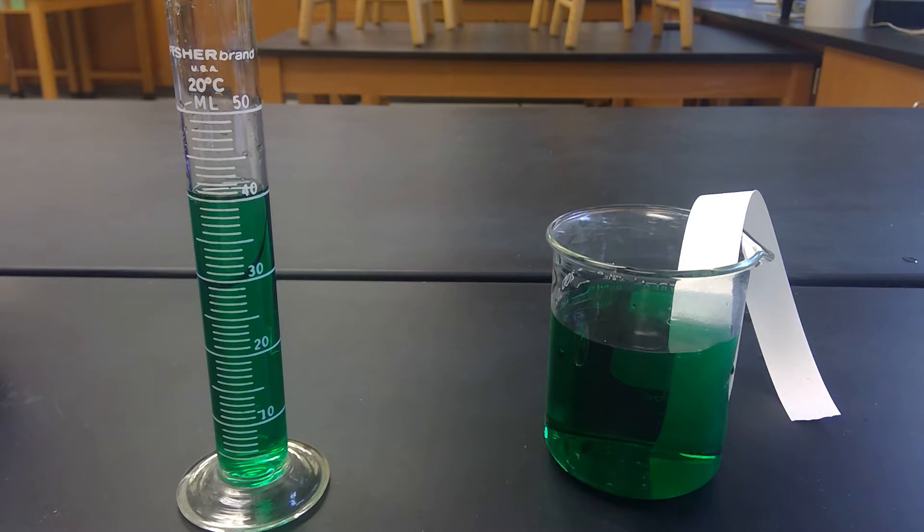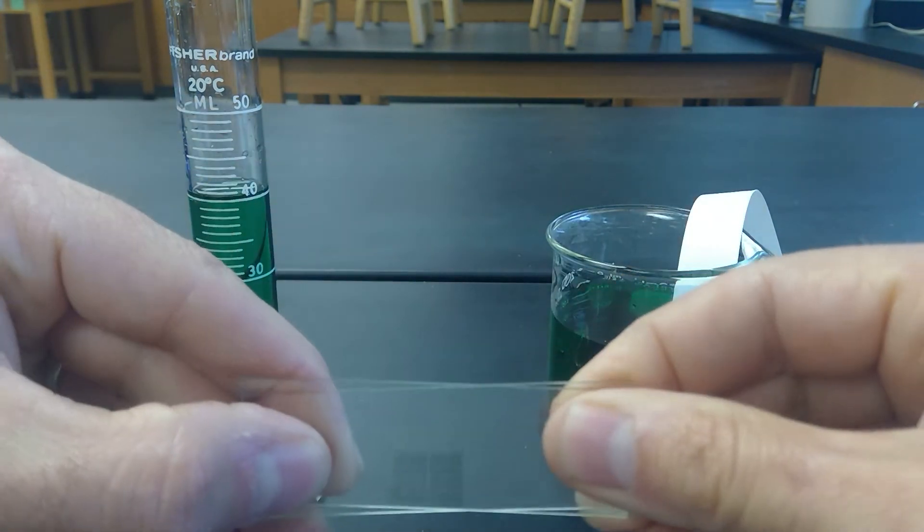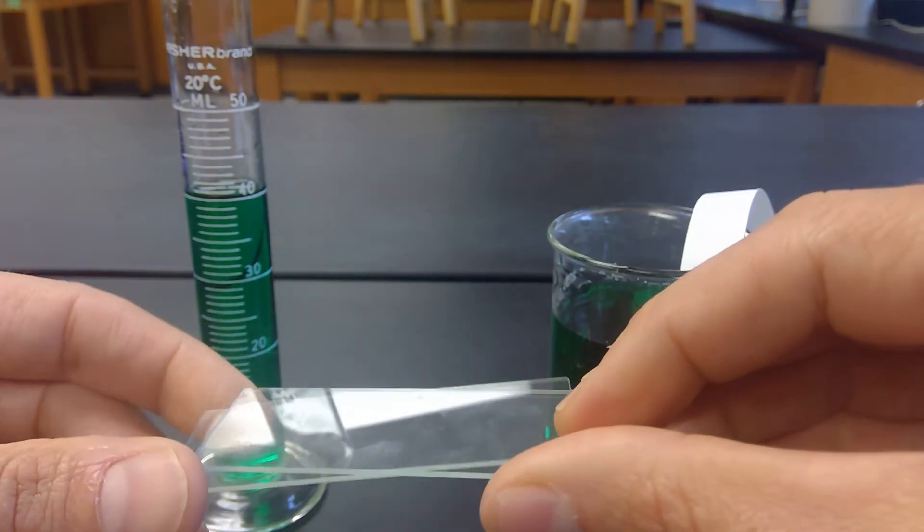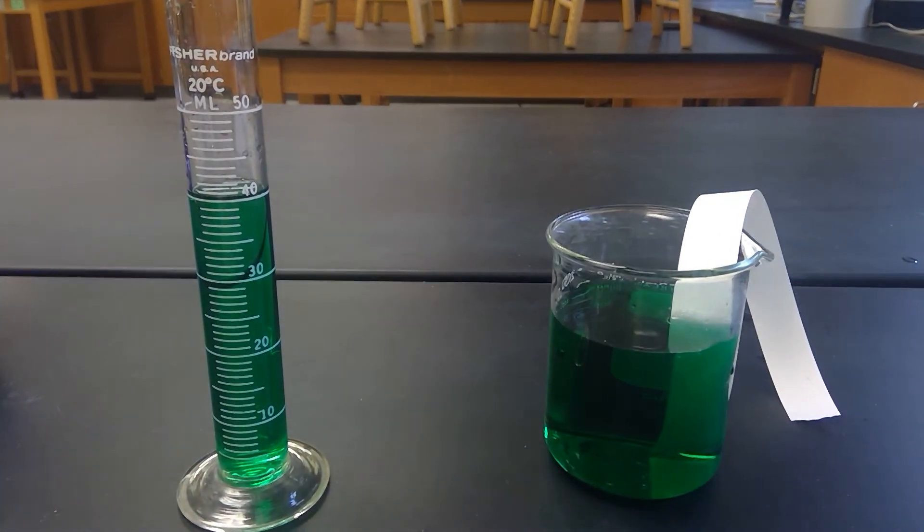So for part A, I'm going to start with two dry slides and I'm going to press them together and see if they stick. They do kind of stick a little bit. I think that's because they're not a hundred percent dry. So I'm going to dry these off much better.